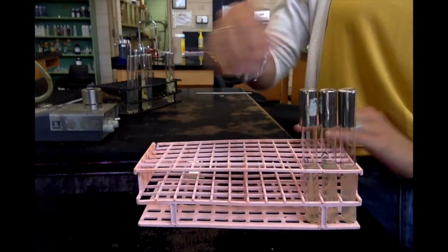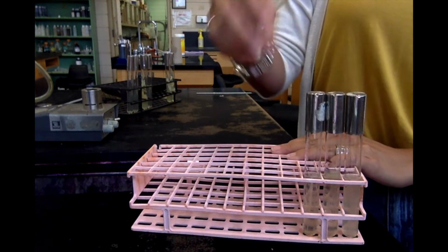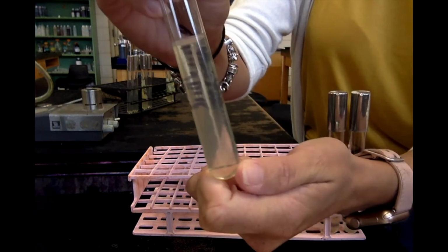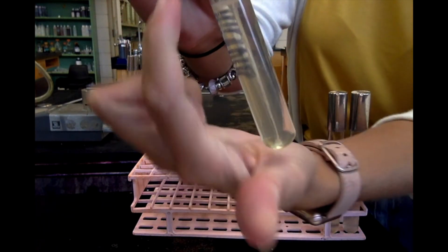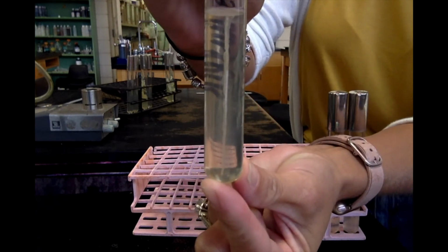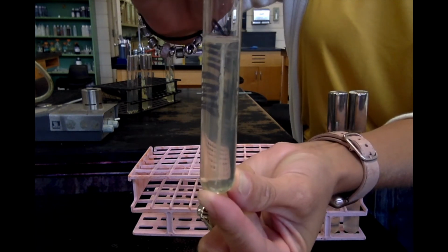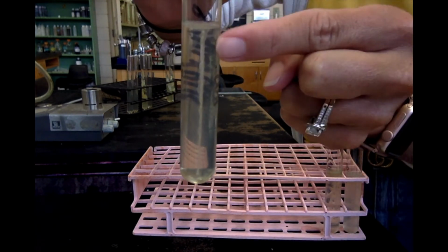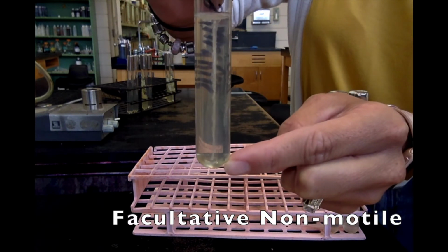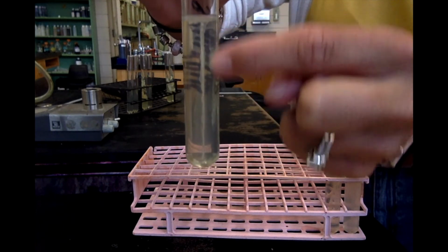Okay, so here's my 3 tubes. This is my 3 different results. Okay, and so the first one that we're going to go over is the staph. Okay, so as you can see, there is a line, a white line of bacteria going straight down the center. Okay, so this bacteria would be facultative because it grew at the top where there's oxygen and at the bottom where there's no oxygen. And it would be non-motile because it didn't move away from my stab line.